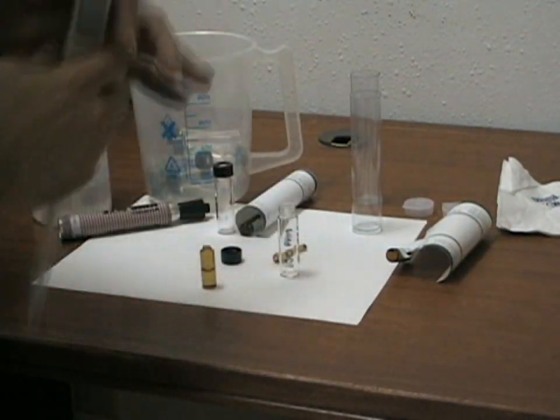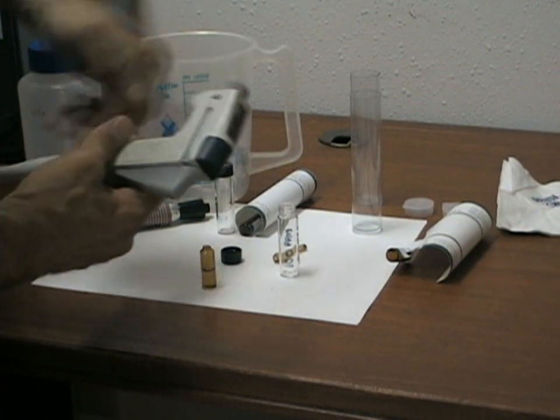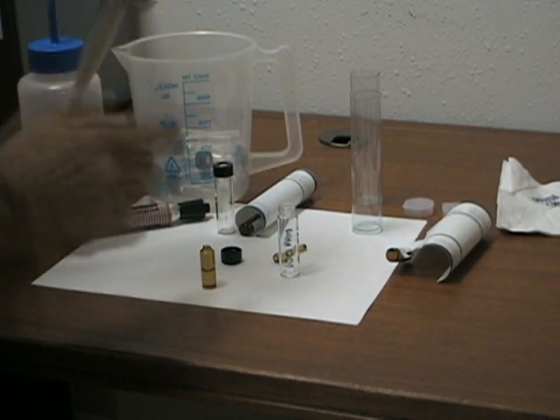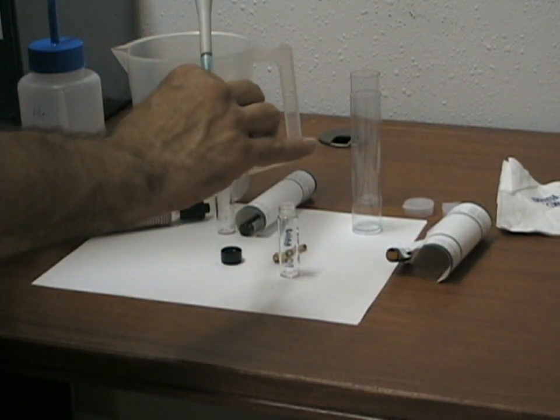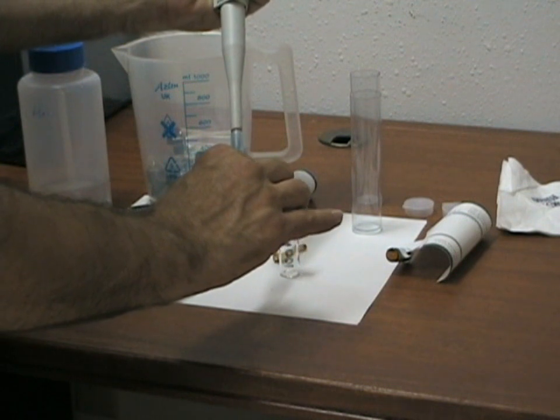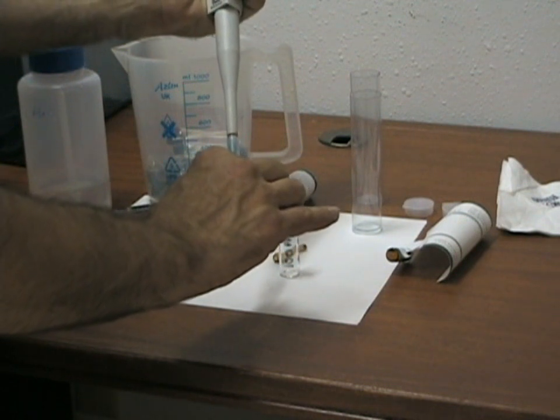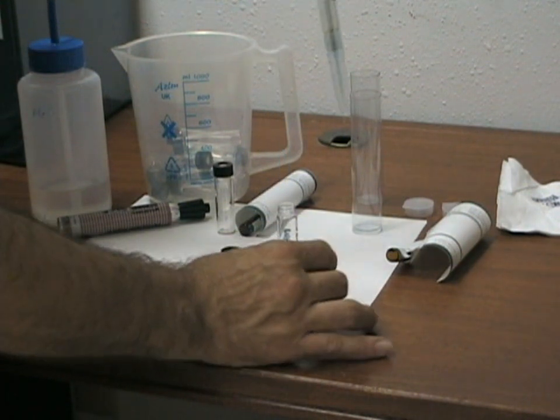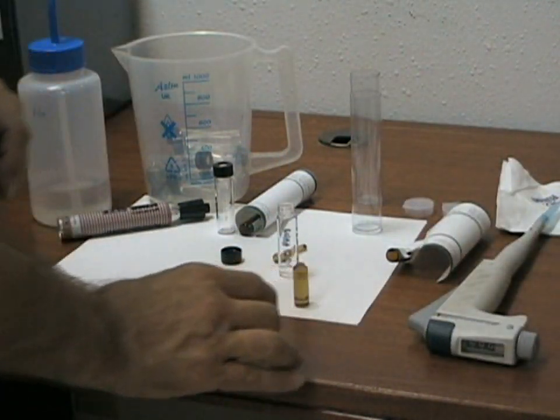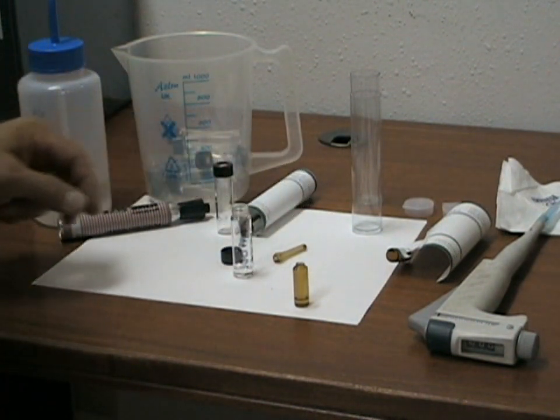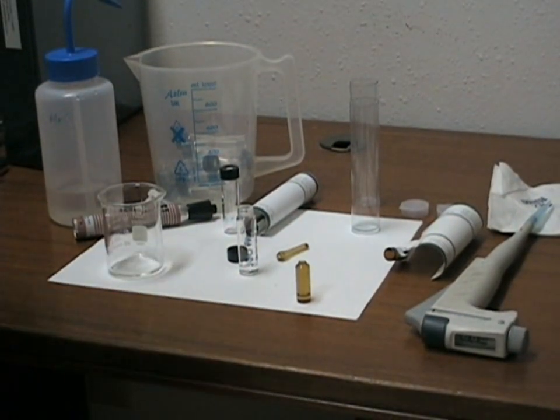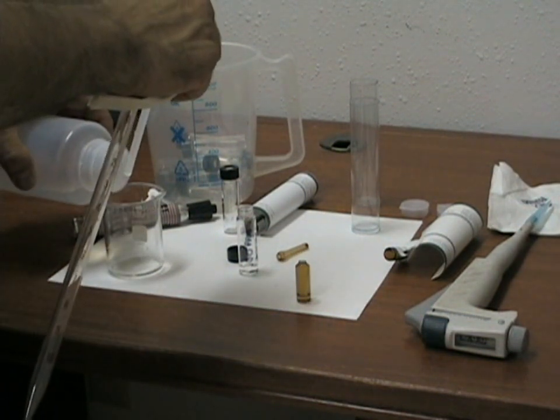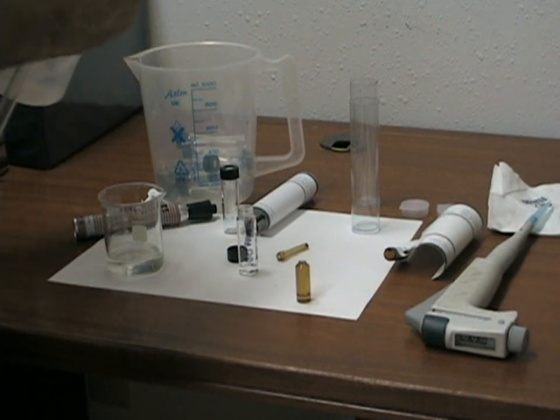Using your digital pipette set to 1 milliliter, carefully remove 1 milliliter of the concentrated acetaldehyde and then using a graduated cylinder add 9 milliliters of water.